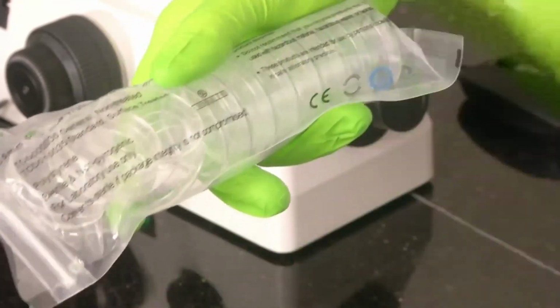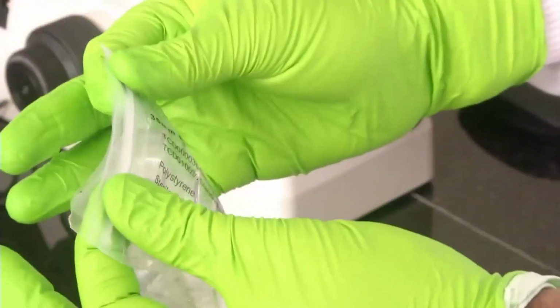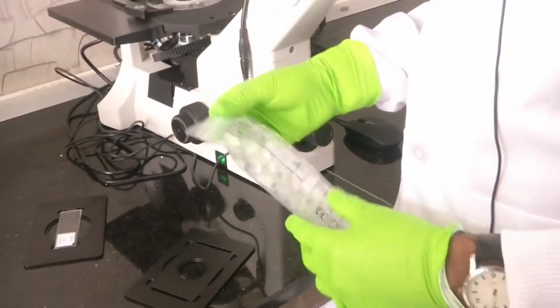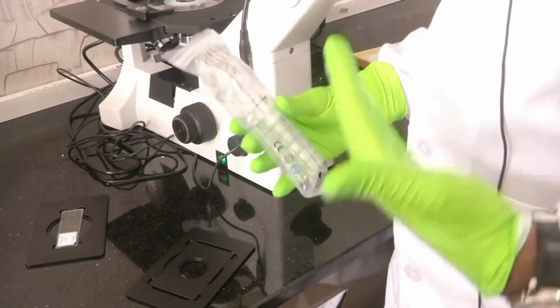What they are telling is, we can guarantee you sterility or cleanliness only so long as the packaging that we have given to you is not opened. After that, it is your responsibility to make sure of contamination. This is why again the need for a clean room environment comes in. That is why we are maintaining the environment in a very clean manner, as also personal hygiene.